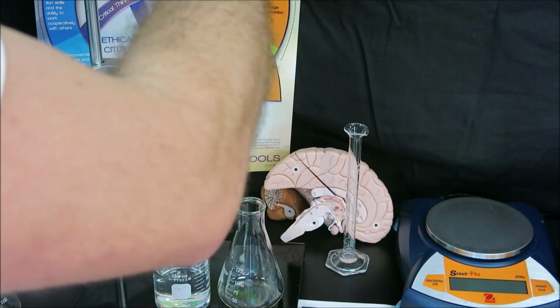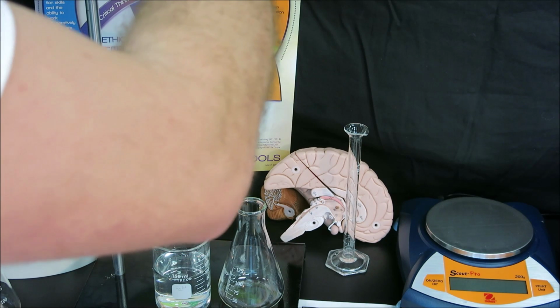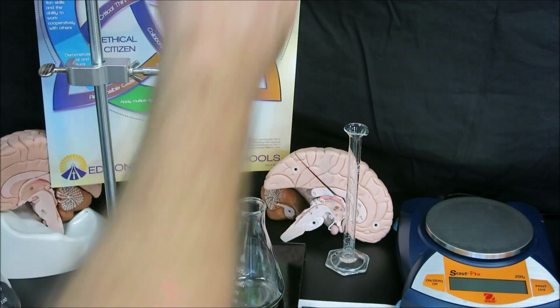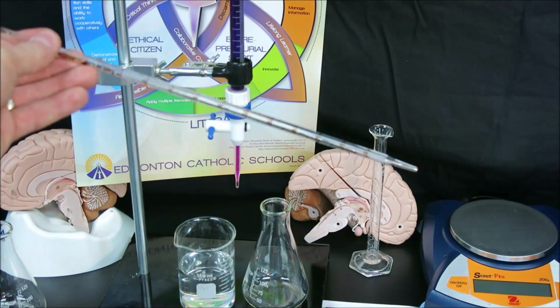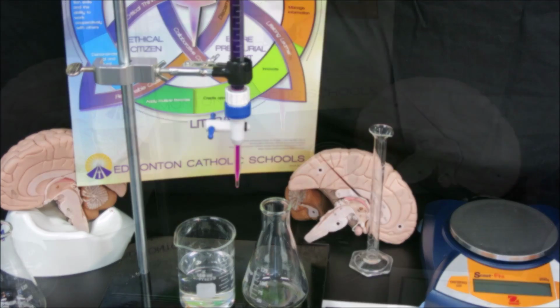Now our sample size is 10 milliliters. So we're going to use our graduated cylinder to measure out 10 milliliters. In a very accurate titration, it would be important to use a pipette to measure out a sample. And measuring with a pipette is called taking an aliquot of the sample. But in our case, we're just going to use our graduated cylinder to simplify it. And then we're going to go ahead and titrate our sample.